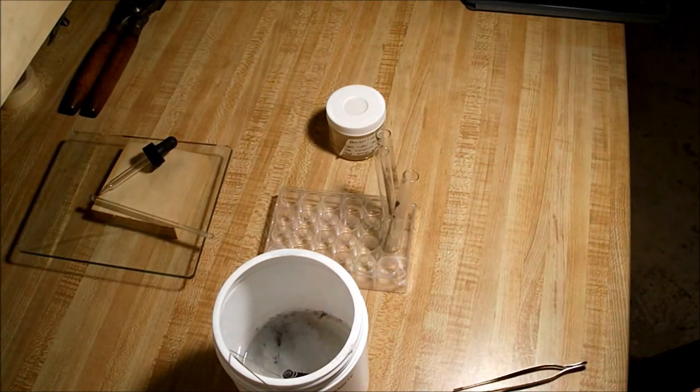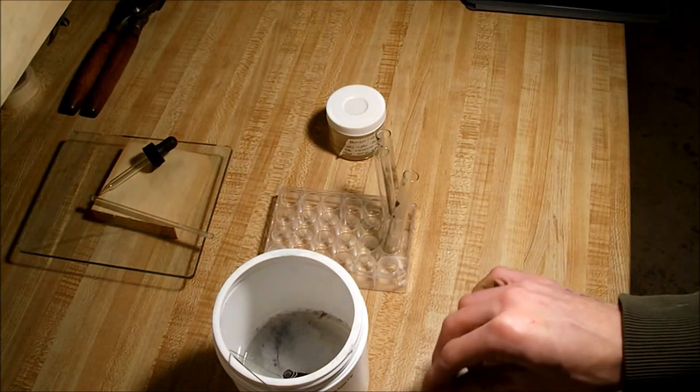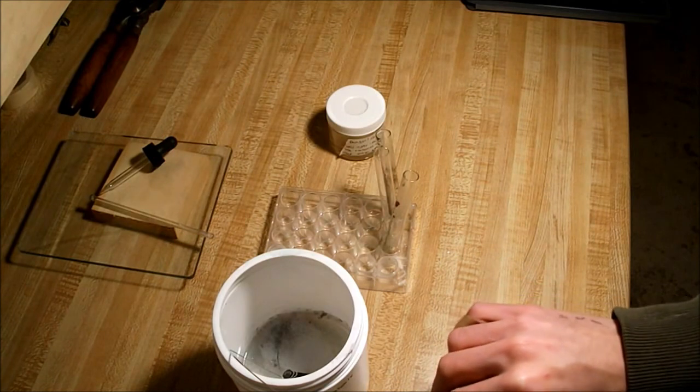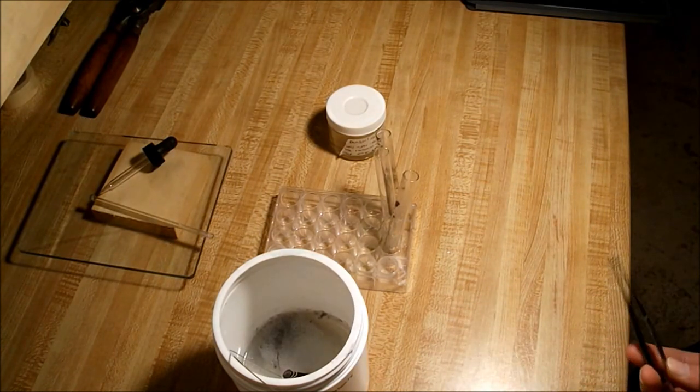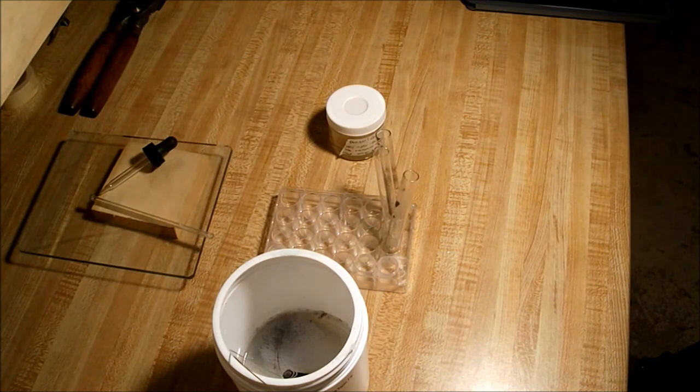And you may get an odor that smells like fish. It's kind of an interesting odor, I've never had that happen before. You want to leave it in there overnight, so it can neutralize all the way. And then you can just pour it out down the sink.